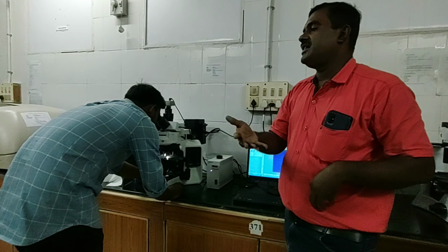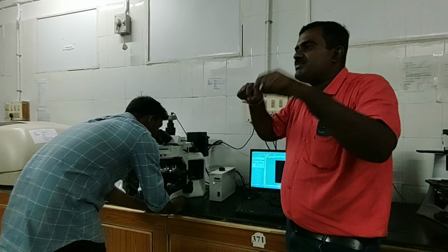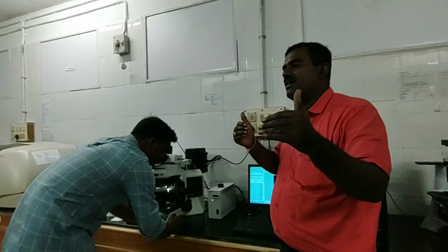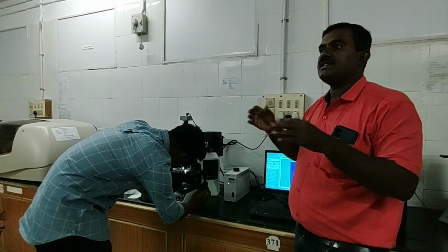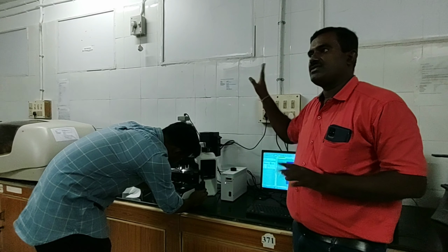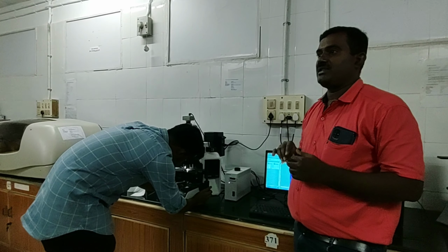But when we put in cell cultures that were given a treatment, the DNA has been broken into small pieces. That means the cell is getting degraded, because the fluorescent dye is bound to the different small pieces, and it is noticed that the nucleus has been disrupted, so the cell is going to be thrown into apoptosis. So our molecule has worked. So that is the beauty with this piece.